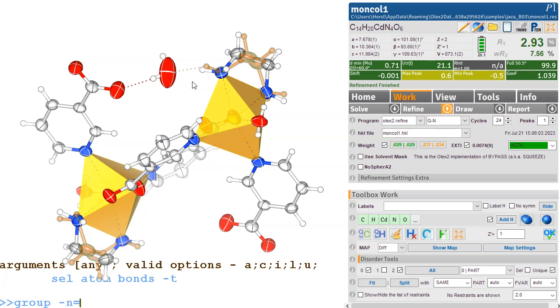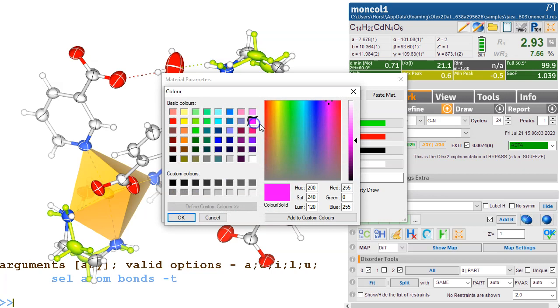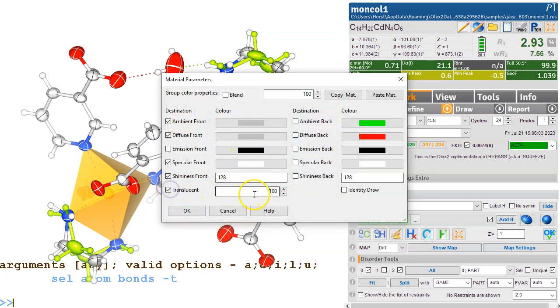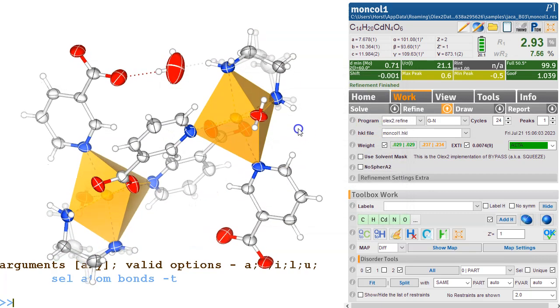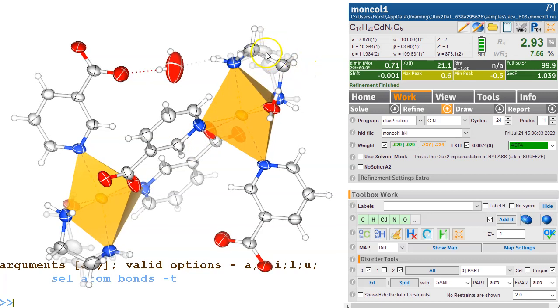Group -n equals, you can give it any name you like. Let's call it, I don't know, P2 for part 2, name -n P2. So the default style is that sort of nasty green, but you can right click on this, graphics, draw style, and you can select something more pleasing. So let's say I'm selecting this gray, and I'm also selecting a gray for this, and I'm making it translucent, let's say 40%. And if we do that, then you can sort of see the shadowy background, so you can see it's there, and that might signify it's disordered here.